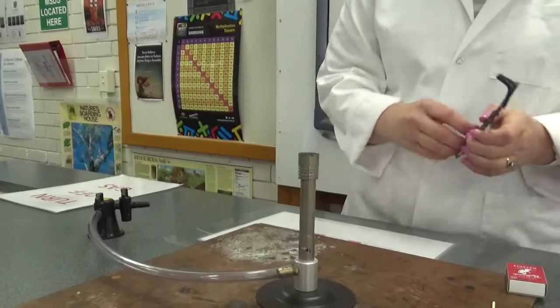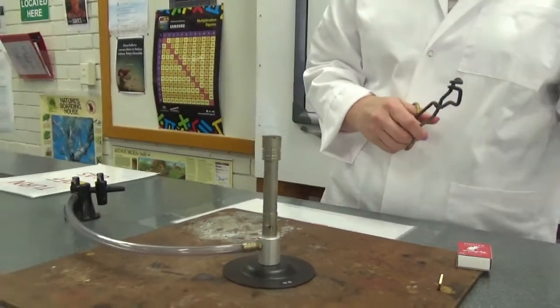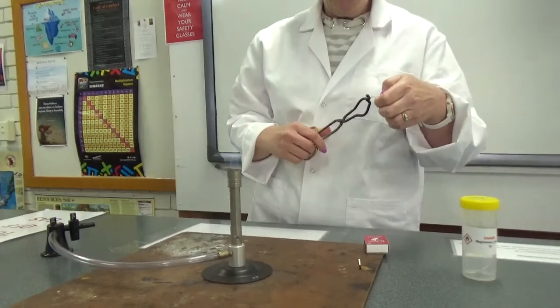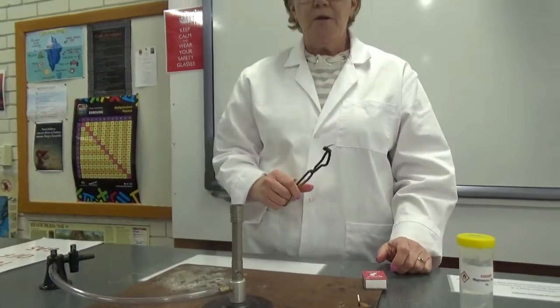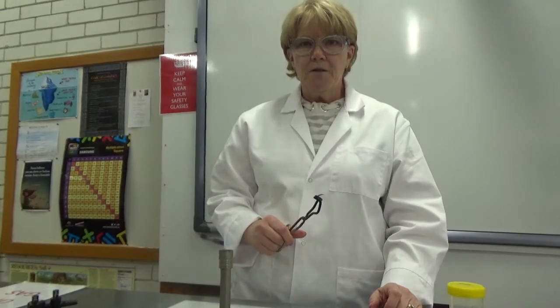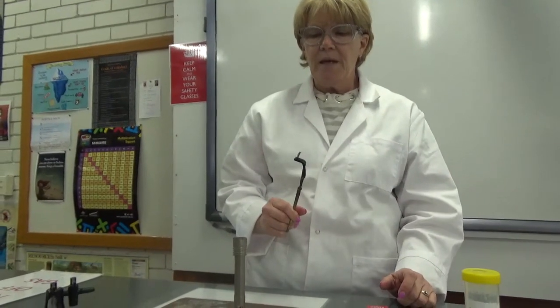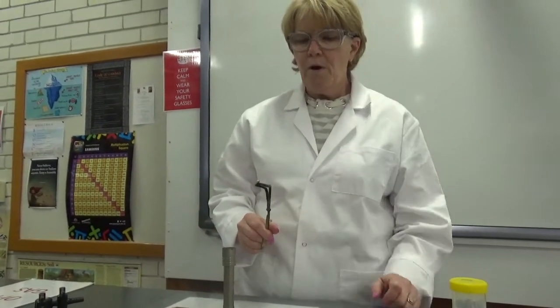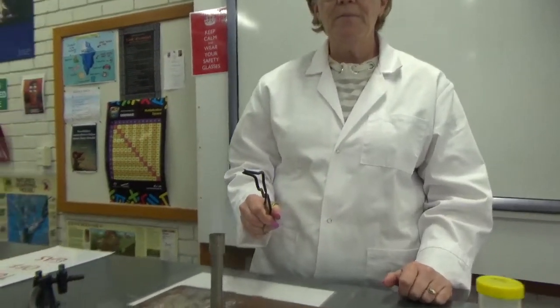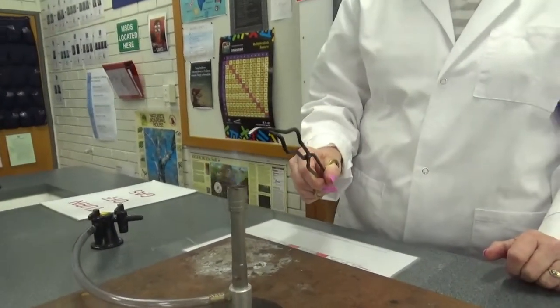Now, when you burn magnesium, you have to be very careful not to look directly at the flame for a long time because it's very bright and it could damage your eyes. Okay, so if you were here, you would be looking away. So I'm going to put the end of the magnesium into the tip of the blue cone. That's the hottest part of the flame, and you should be able to see it ignite.